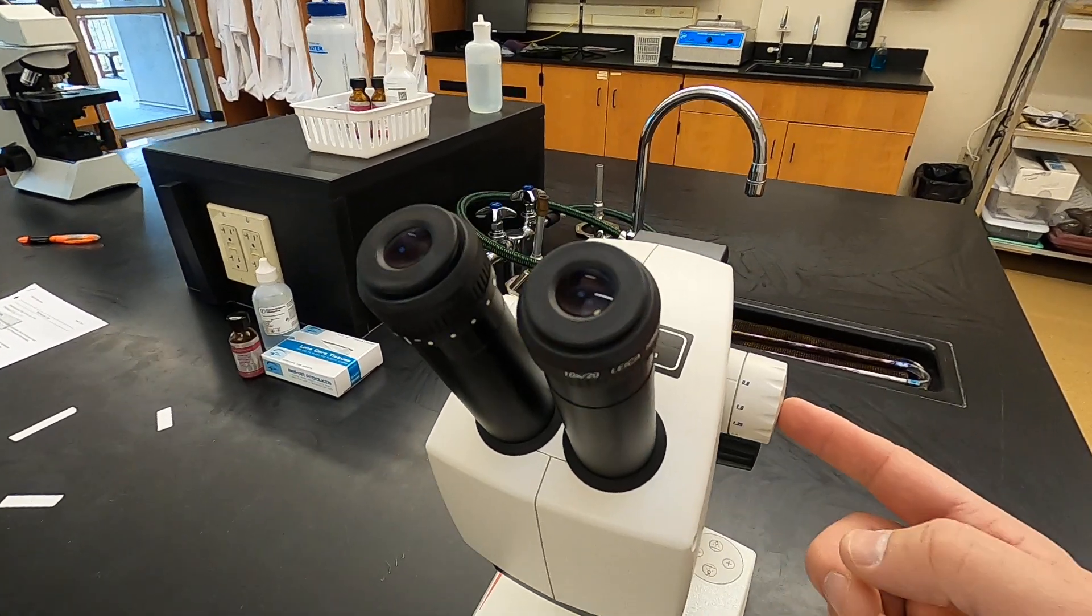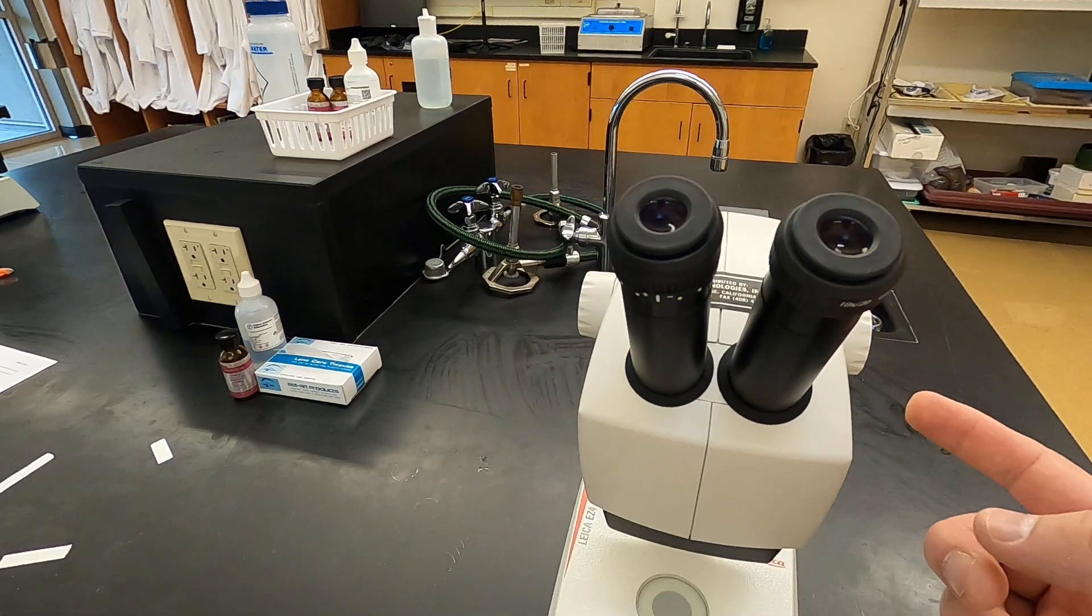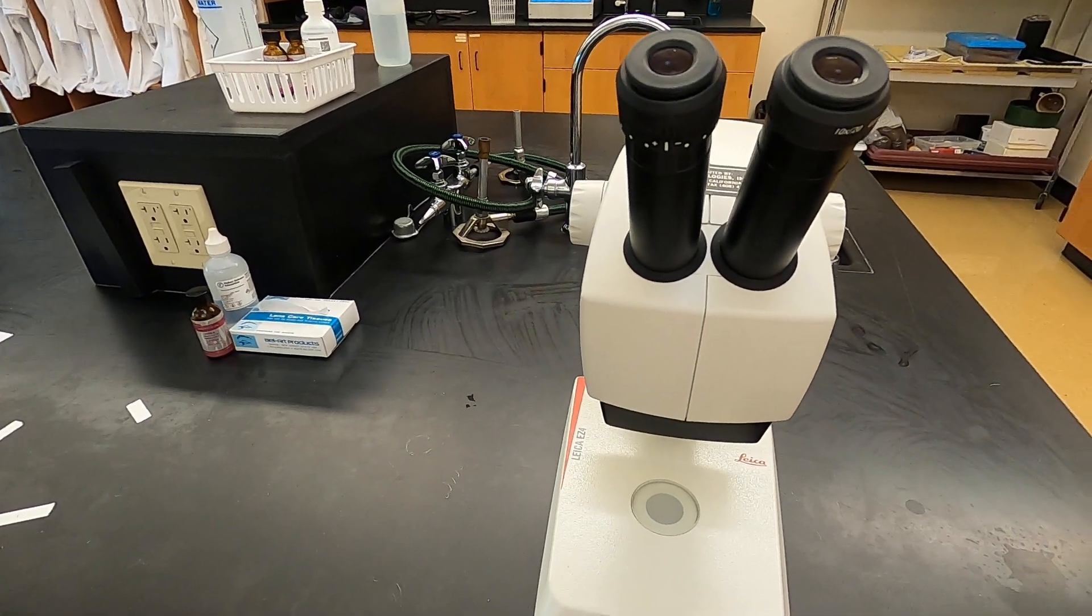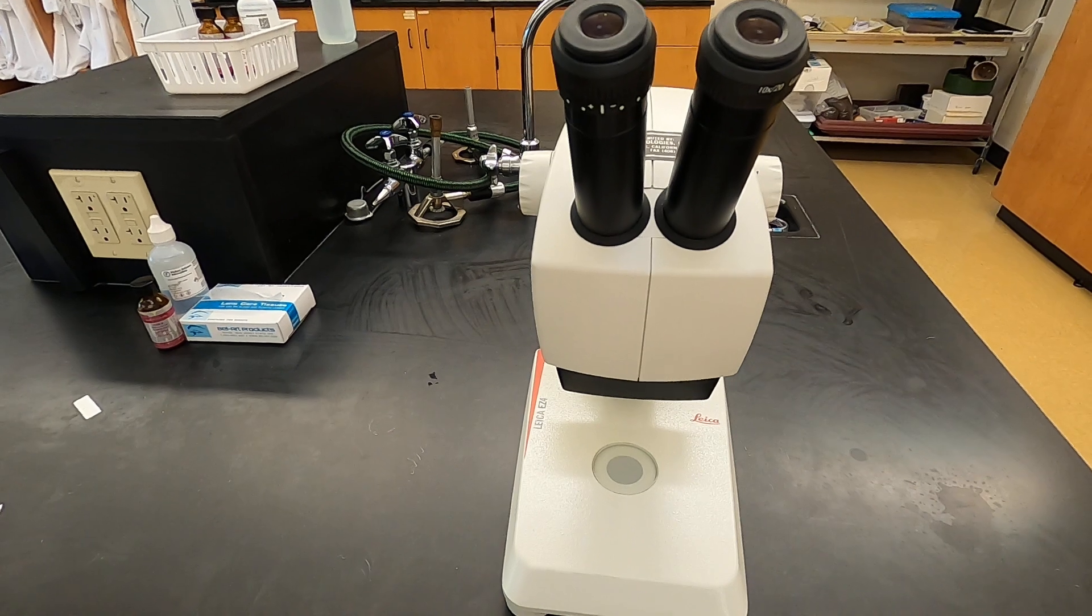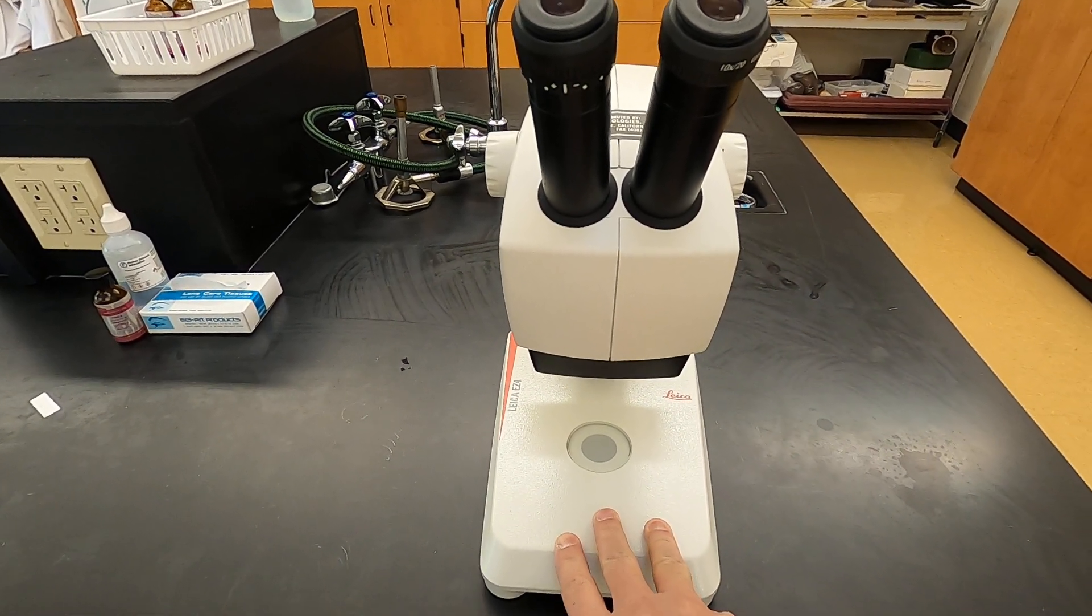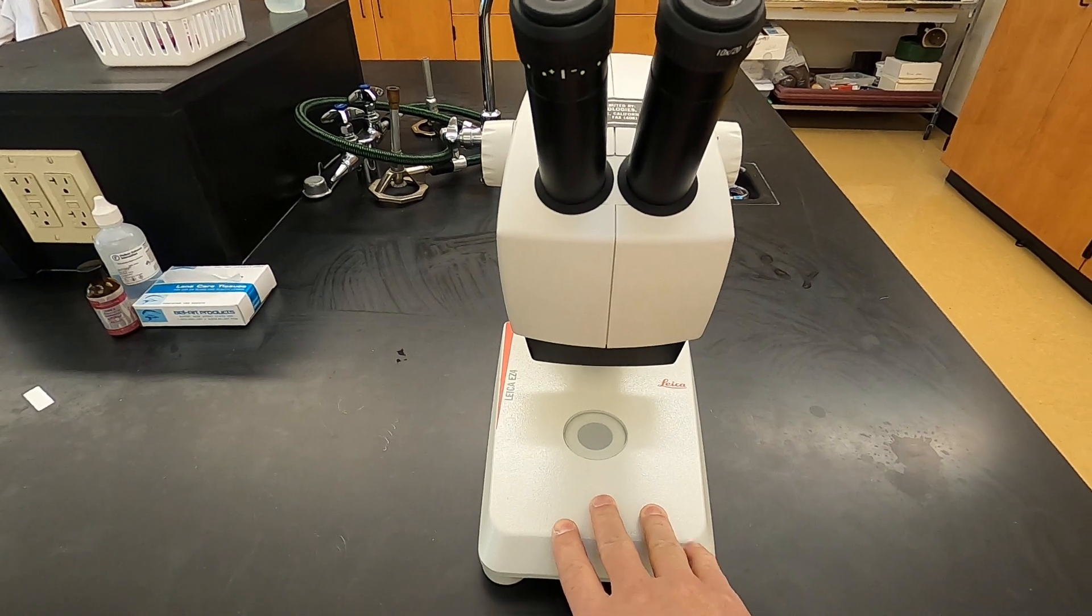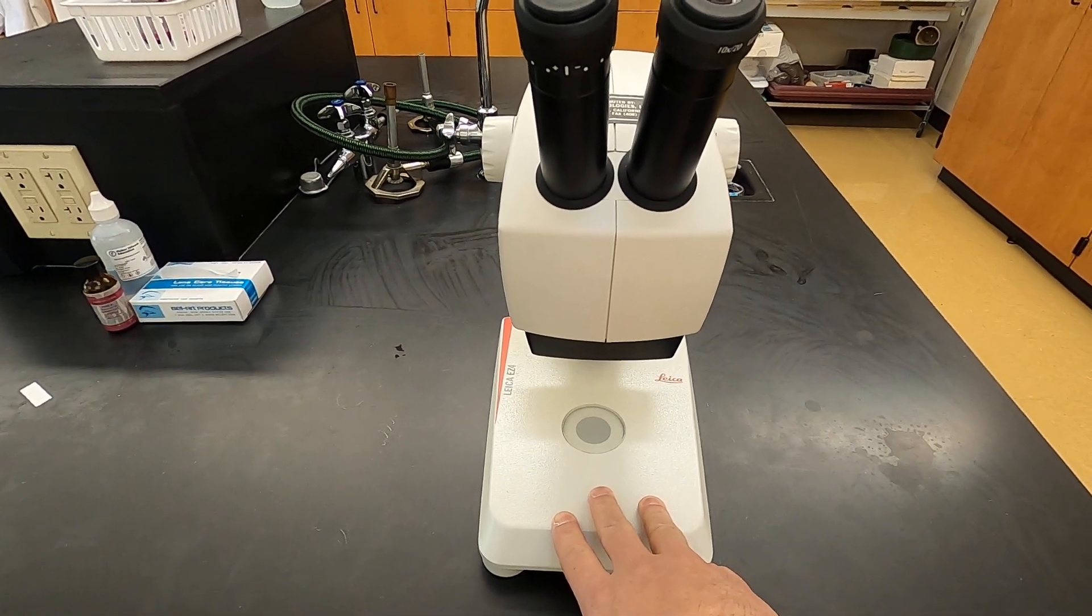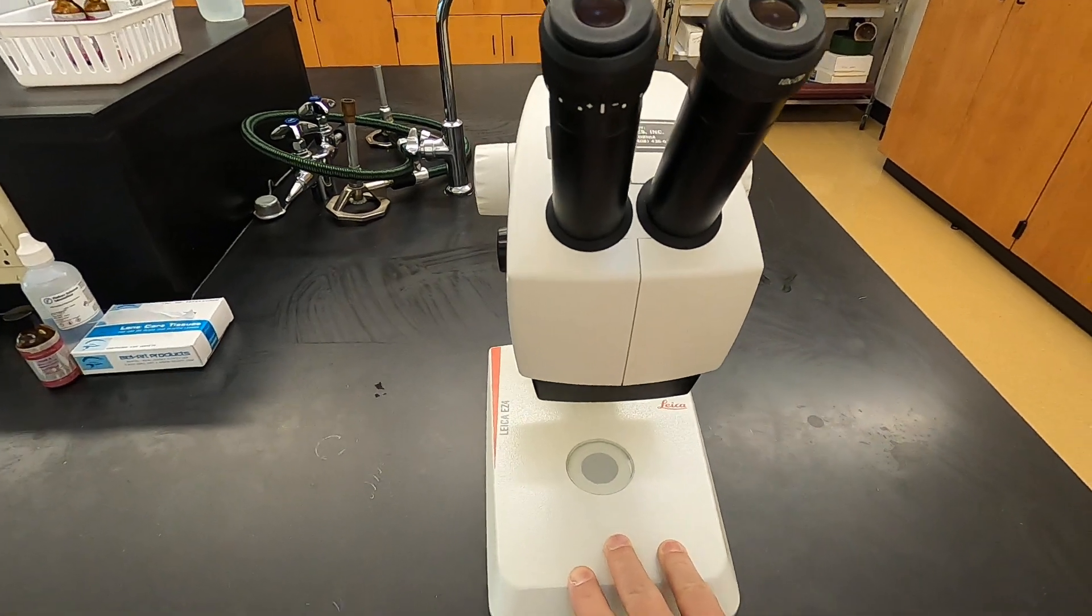So these are much simpler to use than the compound microscopes. We're not going to get as much magnification, but these are great for looking at larger samples, maybe some live organisms. We'll be using them to look at some fungus samples that we're going to be growing in lab as well.